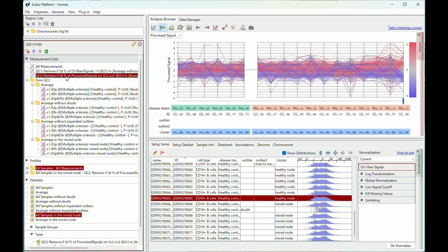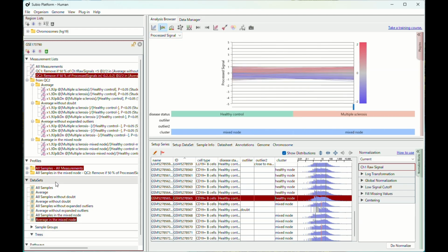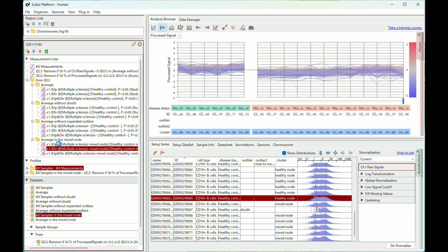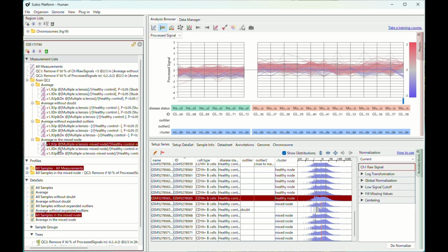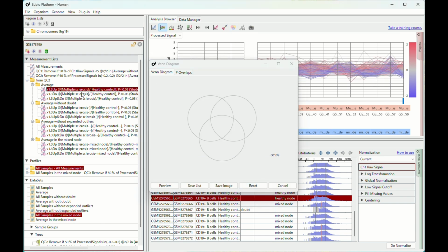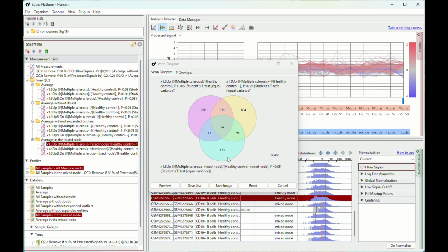If you suspect a batch effect, you can remove the tightly clustered healthy control samples. Without them, there still seems to be a weak difference between the control and diseased groups. You can identify the genes that are subtly differently expressed. You don't see any batch effect this time. Now, let's compare the three up-regulated gene lists from the conflicting assumptions of batch effects. There are only a few genes in the intersection, as you might expect.